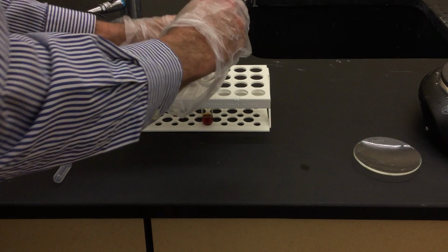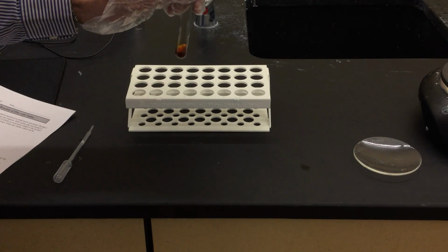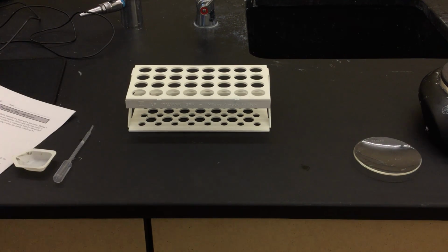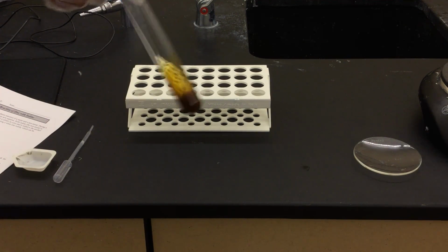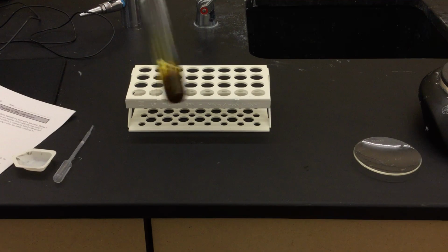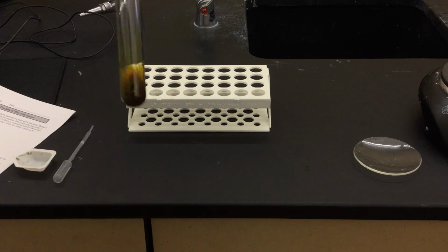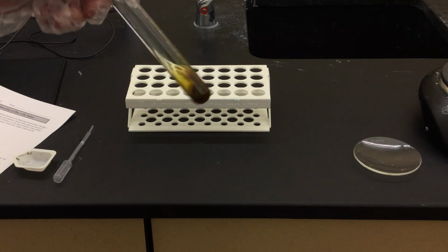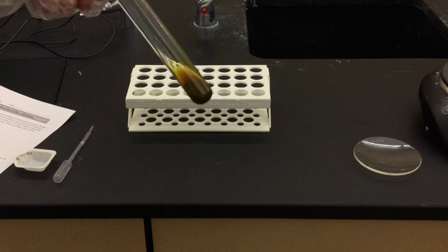But I'm going to be adding this now to the iodine solution now. And I'm going to start to stir. And you'll see a coloration change is going to take place with this. It's not clear anymore. It's becoming a little bit cloudy and it's changing color a little bit. So now at this point, the zinc is actually starting to combine with the iodine and forming our compound. So I'm going to swirl this for about 15 minutes, and then I'm going to come back for the next part of this video.